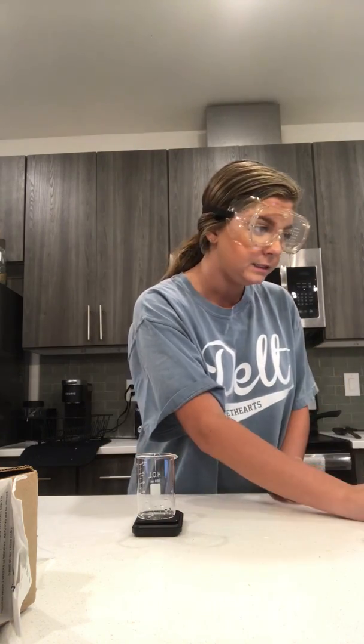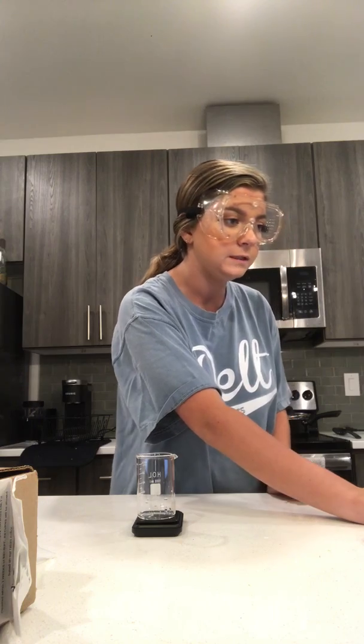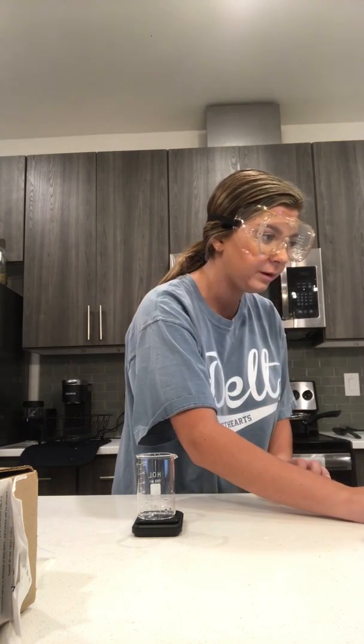So my estimated digit is going to be 8. And then the number of significant figures is going to be 4.